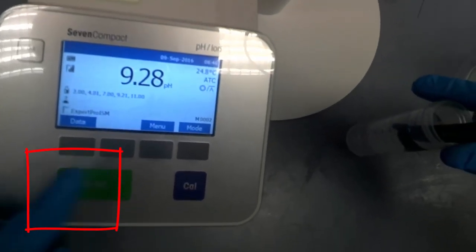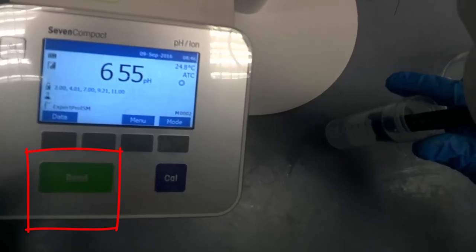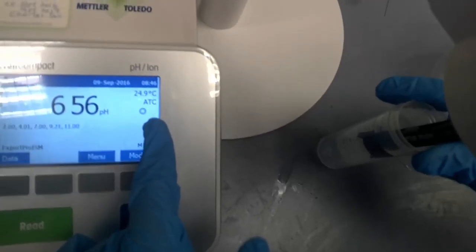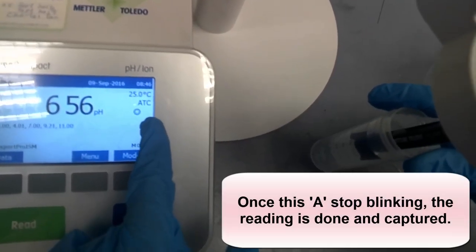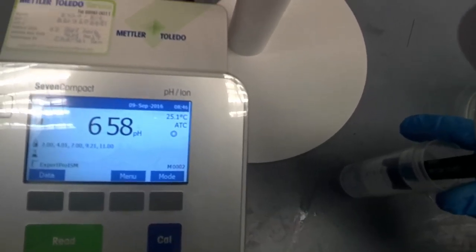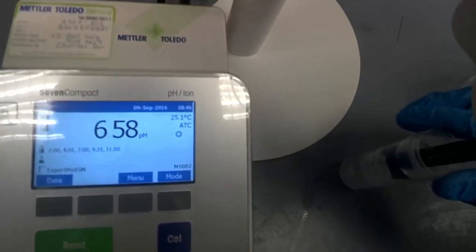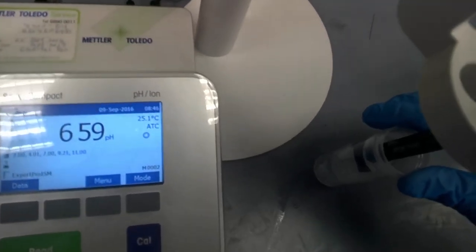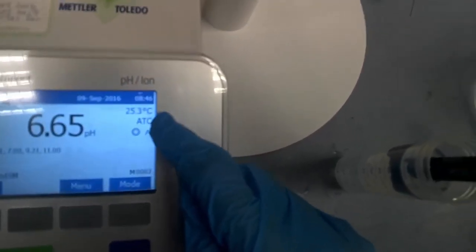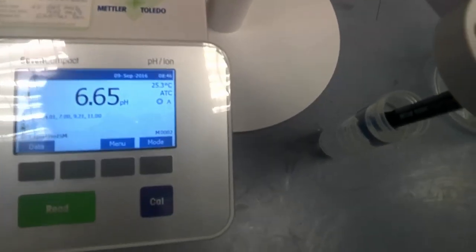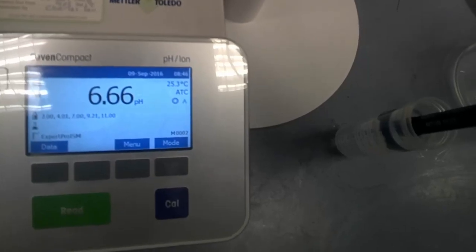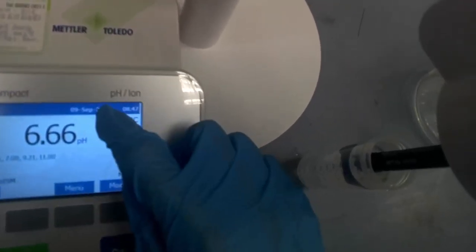So it's detecting. Again, you're going to wait for this signal to confirm the exact pH, very accurate. Make sure that this A is not flashing before you can take down the reading. There should be a sound. But if the lab is too noisy, just watch out for this flashing A. You see now what happens? The temperature increased. So always take note of the temperature that you record your pH reading.